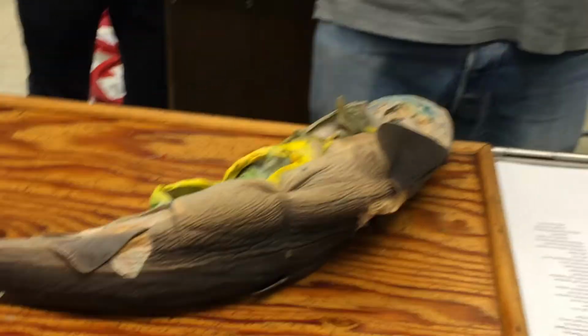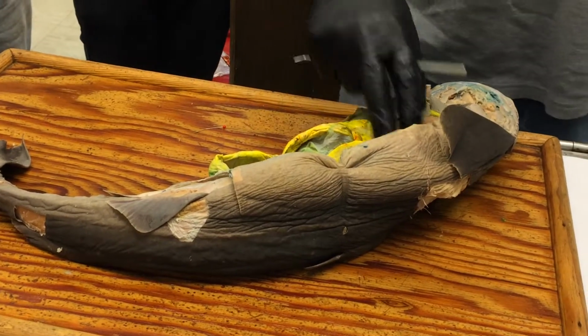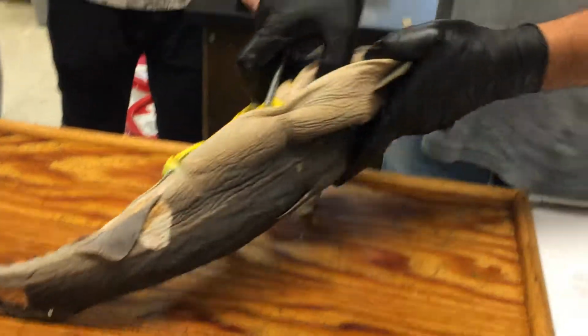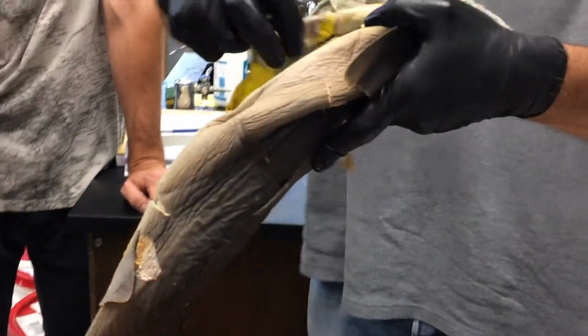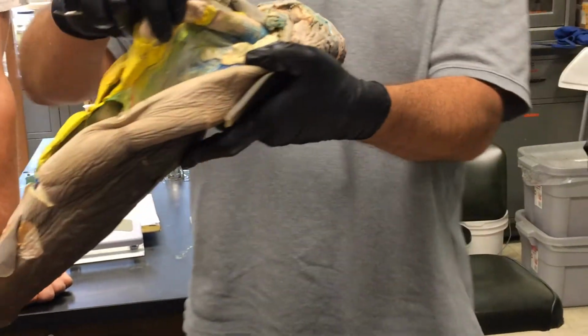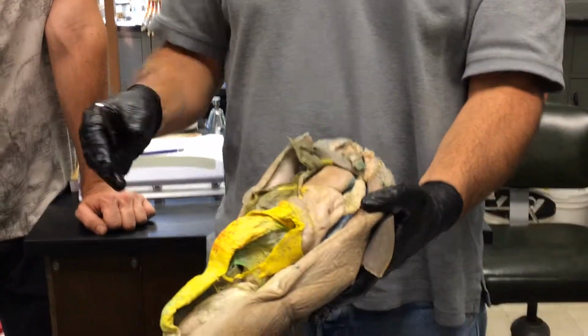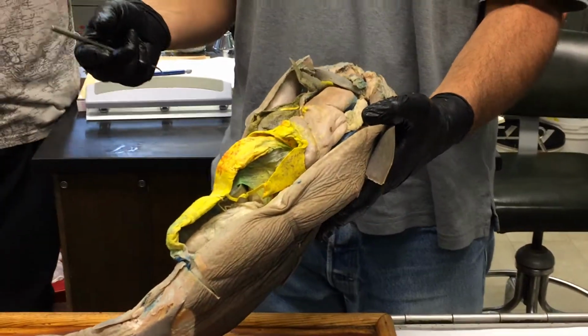And remember, there's dorsal mesentery and ventral mesentery, our two main divisions. And the dorsal mesentery runs between the gut tube and the dorsal body wall. So that's what we see here. That's the dorsal mesentery. Okay.